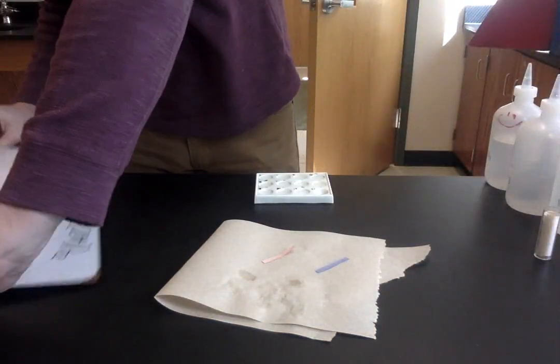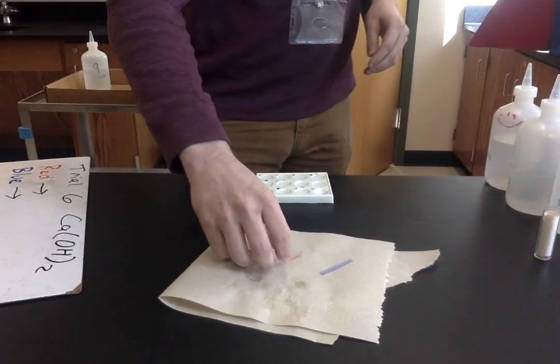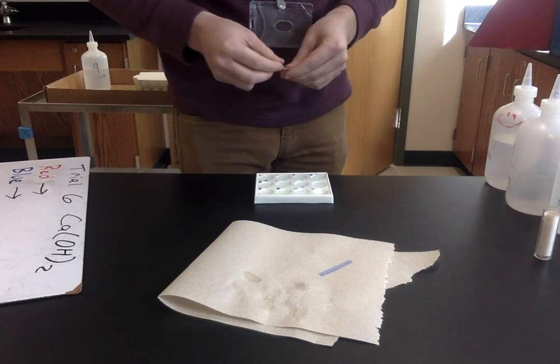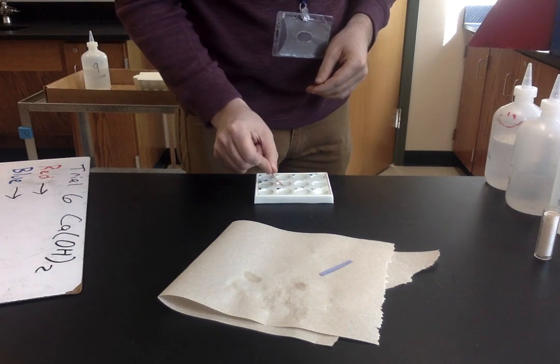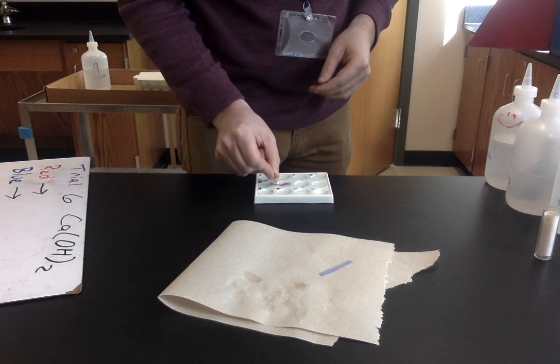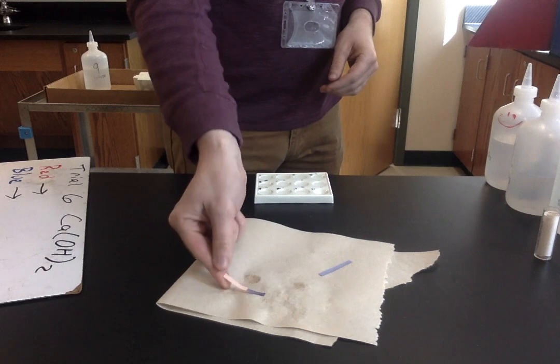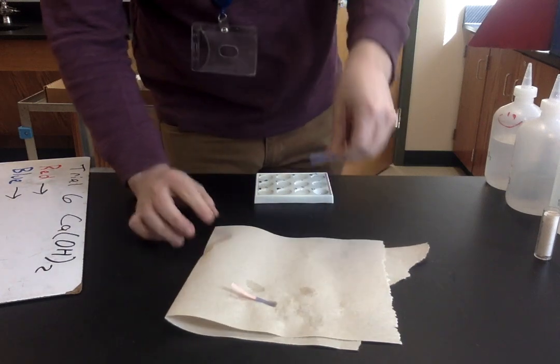So let's go ahead and react with our litmus paper. We'll start with the red, and we'll go to the blue.